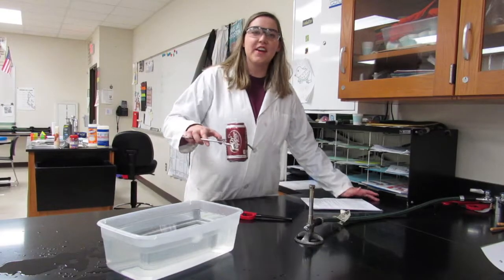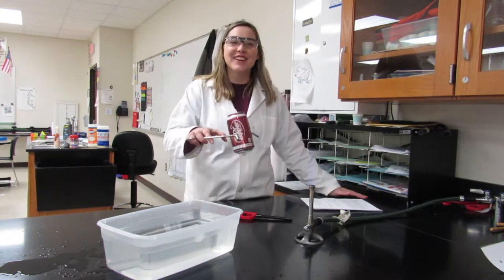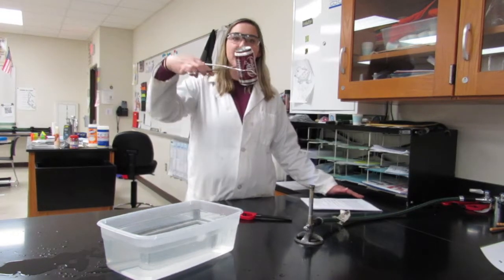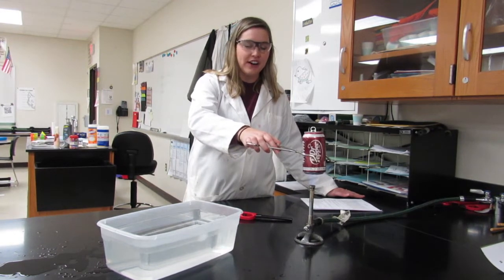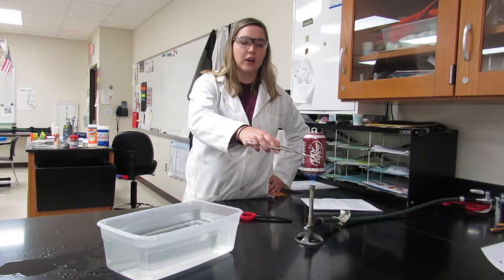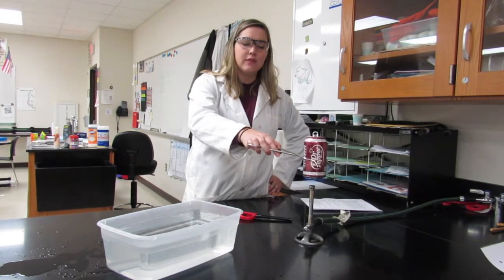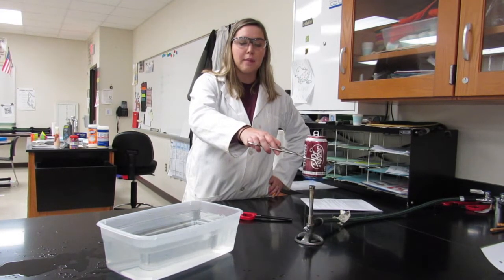Hey guys, another gas law demo video coming at ya. In this one we're going to look at the relationship between temperature and pressure. I've got a Dr Pepper can, and I'm going to heat it over my Bunsen burner. What I'm trying to do is heat the gas inside my can. I've put about 15 milliliters of water in there, and I want to get that water really hot and boiling. I'm going to heat it for about 30-45 seconds, just until I see the steam coming out of the top of the can.